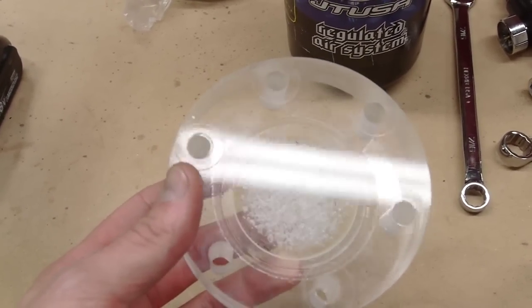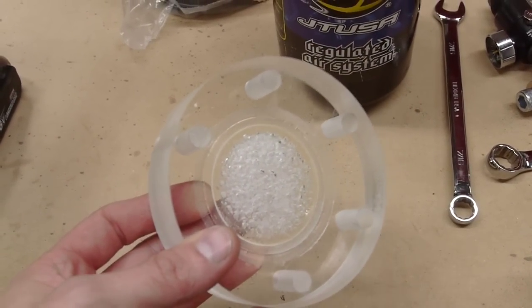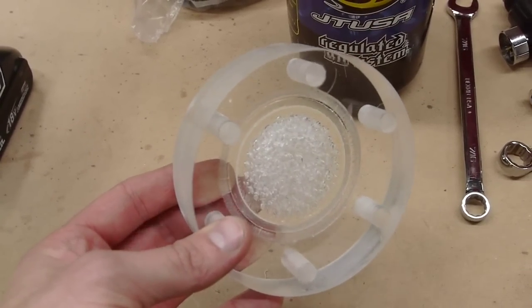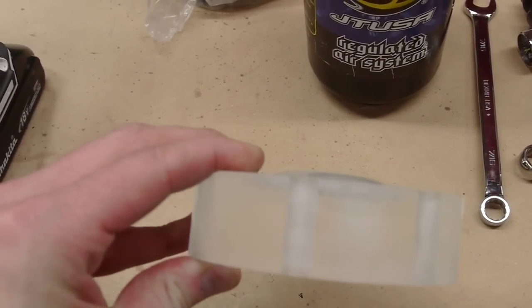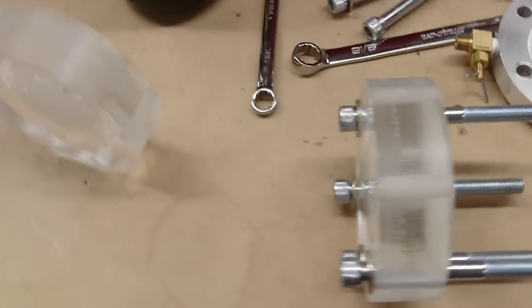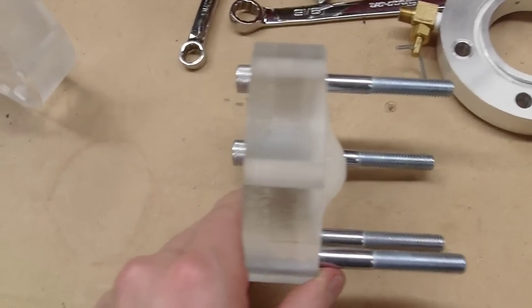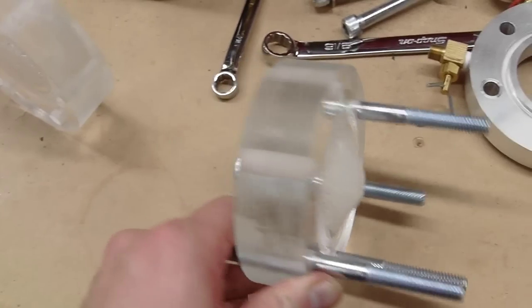All I did was fill it up with liquid CO2, so it's about 750 psi, and it was sitting there for the week. And then I opened it, and this didn't happen instantly. I opened it, and the plastic more or less looked okay. So I went away for a few hours, and when I came back to the shop, this is what the plastic looked like. Very strange.